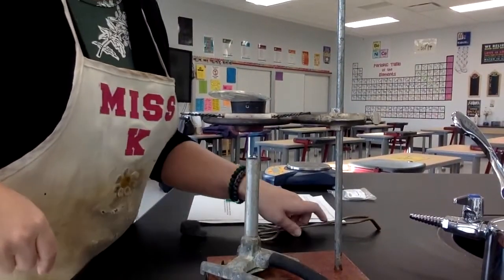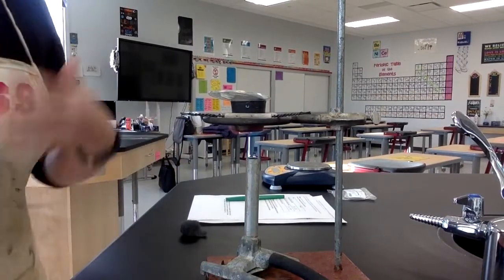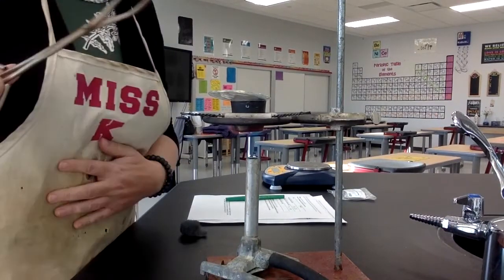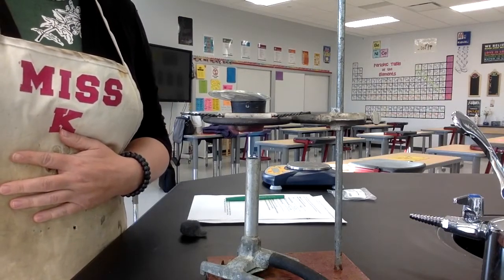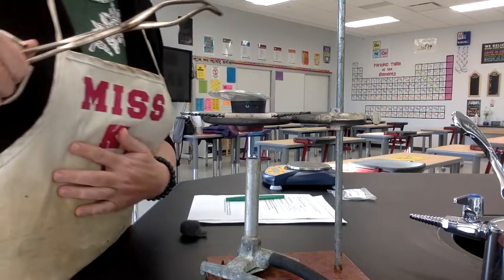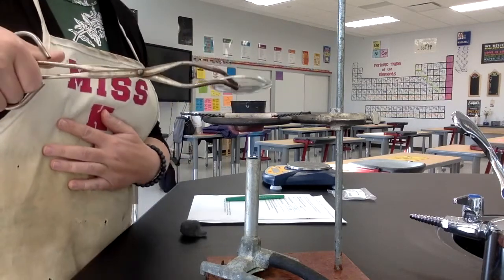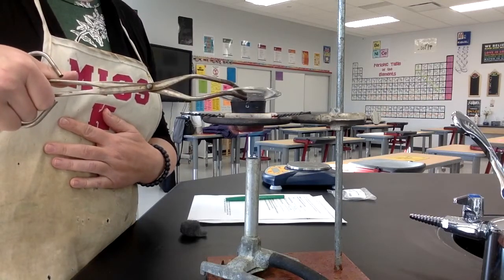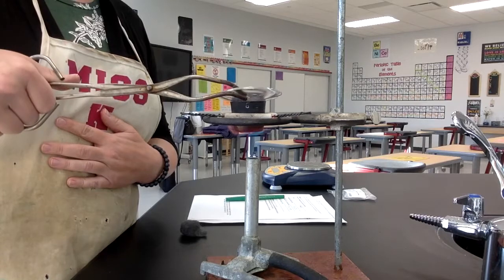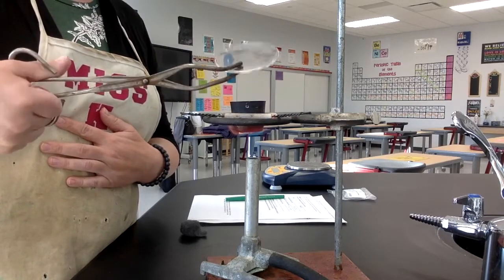So now I'm going to keep giving the reaction some gulps of oxygen, but I don't want to keep the cover off for too long because that will cool it down. So I'm going to take it on and off. I'm going to give it a gulp of oxygen, and then put the cover back on. And I'm going to keep doing that off and on until I don't see any more glowing.